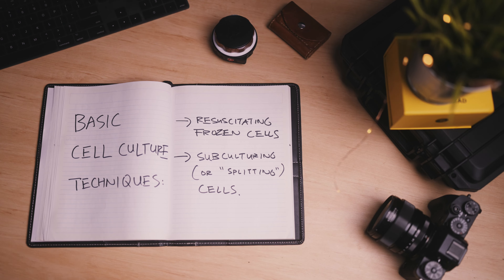Hello, I'm Jack Wang, a microbiologist and science educator based in Australia. This video is the first part in a series on cell culture, where we go through the basic principles of cell handling techniques — in particular, resuscitating frozen cells and subculturing cells so that they continue to grow.